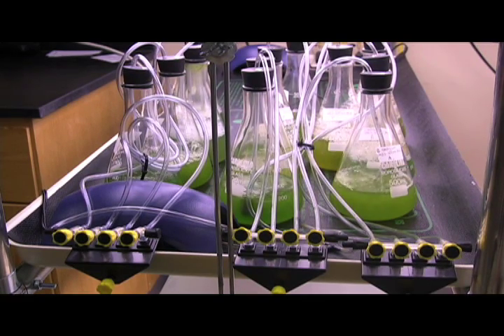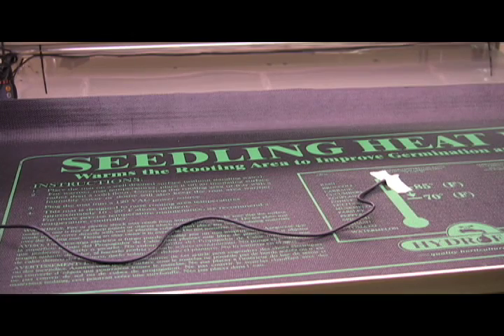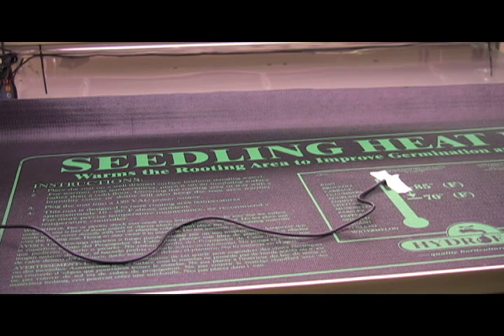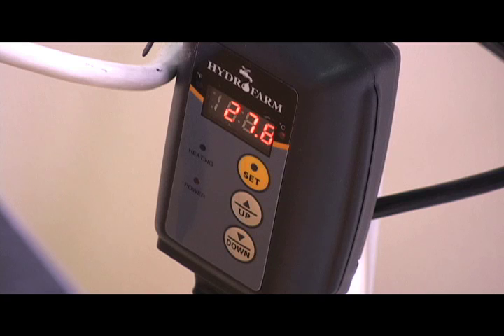For some of our algae, we controlled temperature using heat mats, which were connected to a thermostat controlled with a temperature probe.